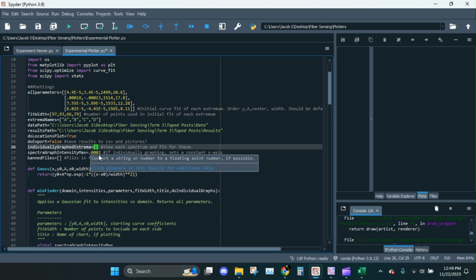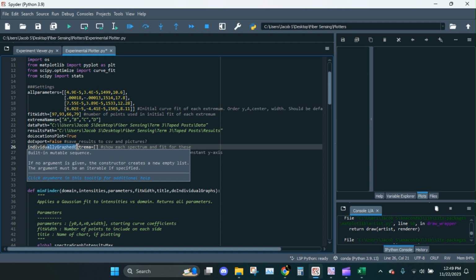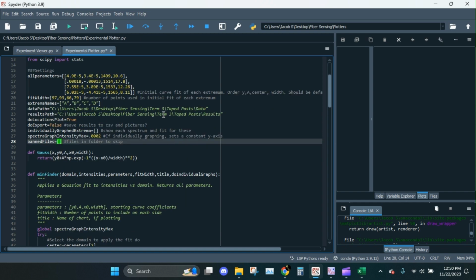Spectra. Okay. This is a subsetting for this. Basically, what this does is it'll graph all of the spectra and it'll highlight the curve fit range it's doing and then graph the curve fit over it. And this will fix the y-axis for that process. But we're not going to be doing that, so it doesn't matter. Banned files. If you know you have problematic files, like a while back, I had one in which the entire pattern flatlined and then came back, so we couldn't fit over that. So I had to skip that one. If you have any files, we could put the names in there, but we're not going to do that right now.